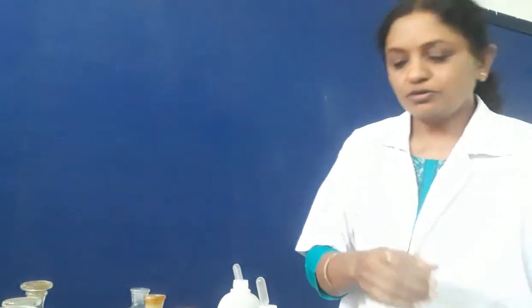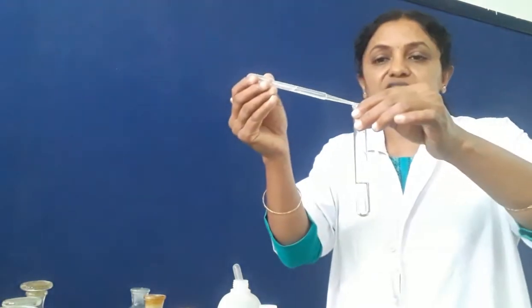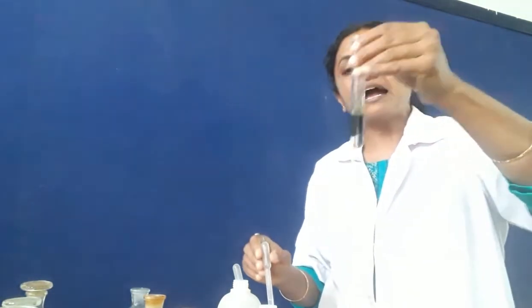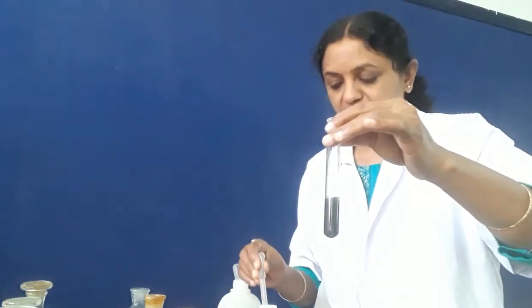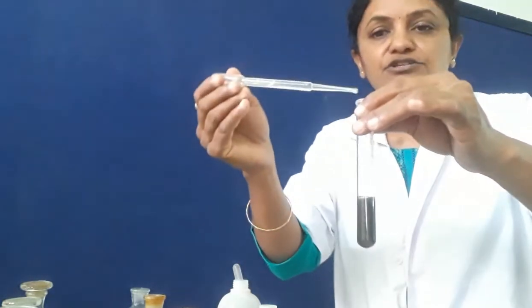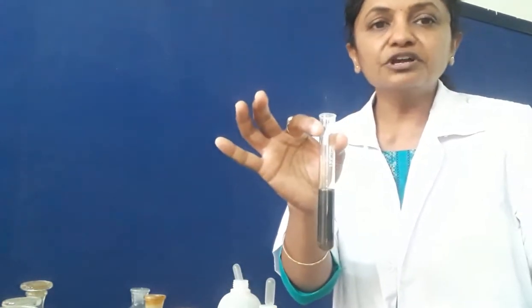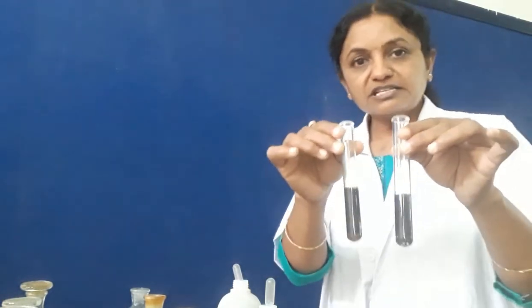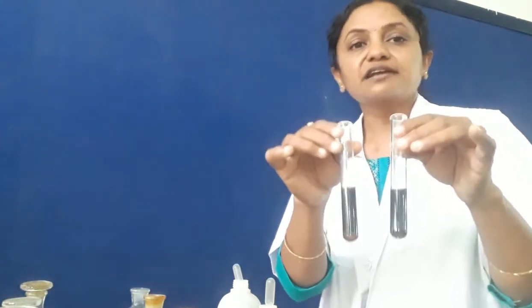In the second test tube with ferrous sulfate, we add a little amount of ammonium hydroxide. Here also you will see a dirty green precipitate. On adding excess of ammonium hydroxide the precipitate remains as it is — it is insoluble. So this confirms that the salt solution has ferrous as the cation.